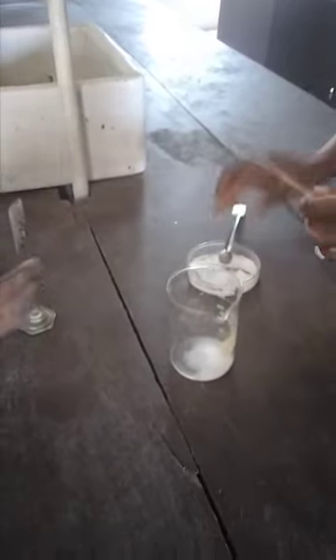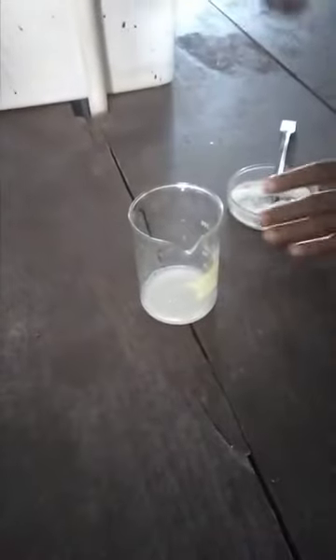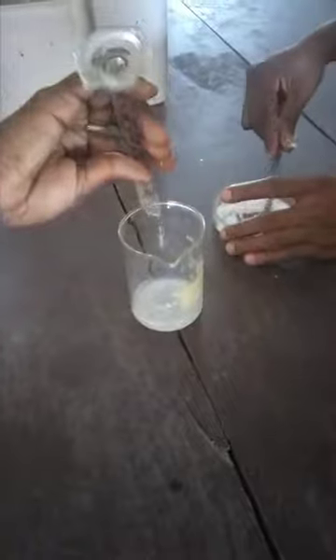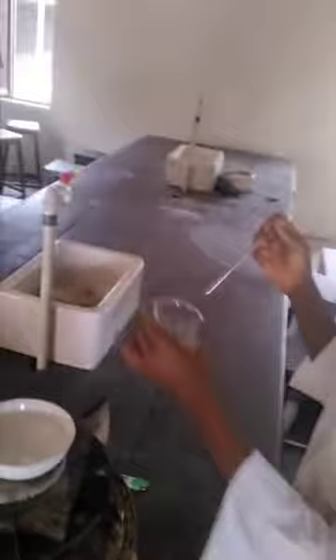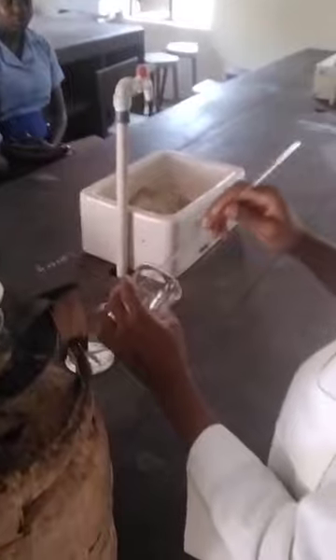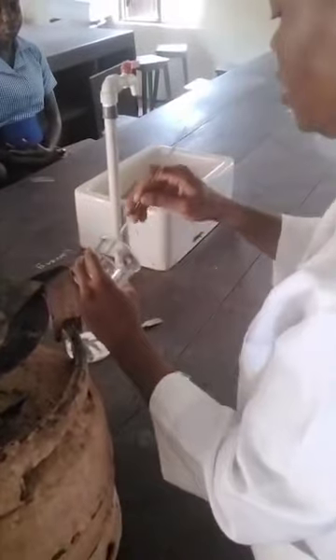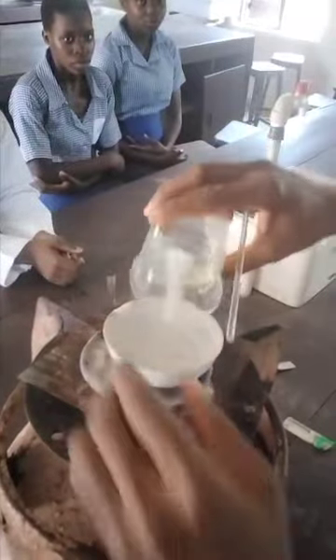Add more salt. So we have a mixture of salt and water. You know salt is soluble in water. Do you know that? Yes. So that's why I'm turning it. Why it's taking time is because we poured too much salt, so we can say that this is a saturated solution. Okay? Okay. So I'll pour this mixture in the evaporating dish.